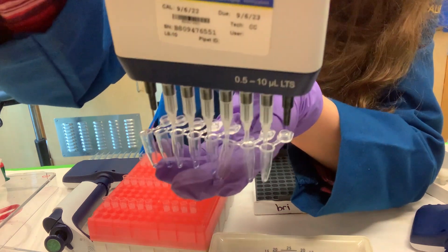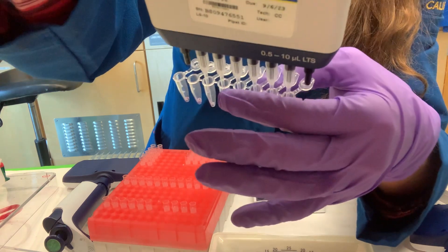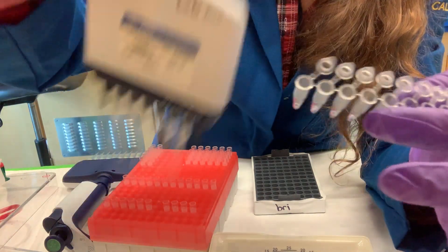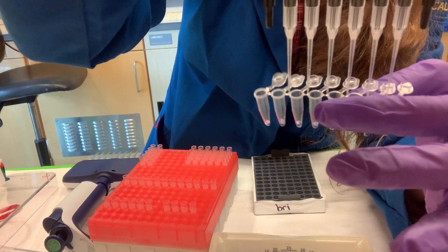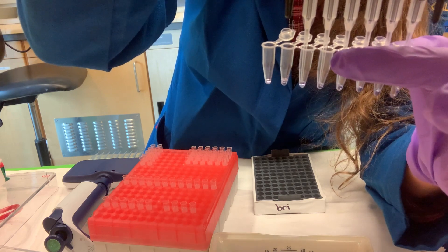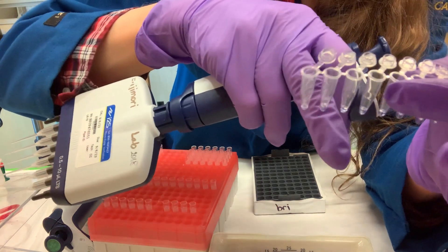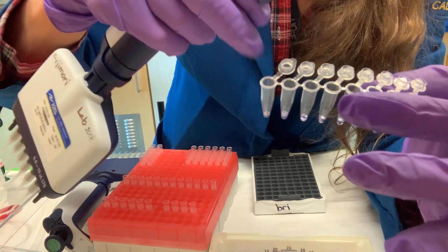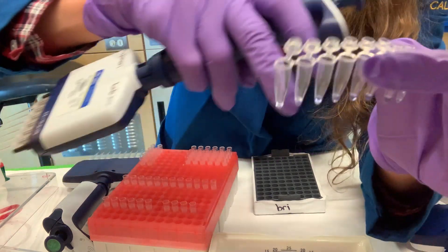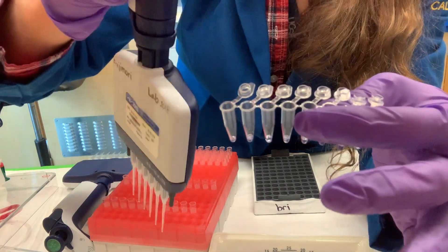You can see the air bubble has moved to the top and now you can pipette up the liquid. It's hard to demonstrate on screen, but normally this would be in a rack or something sturdier. It's really important to be aware that when you do that blowout you often get the sample stuck with an air bubble at the bottom. What can be helpful is to do the blowout not at the very bottom but on the edge, so the liquid contacts the wall and gets out without introducing bubbles. To get rid of bubbles you can spin the tube, or pipette out the air and push the liquid back — that's an option when spinning isn't possible.